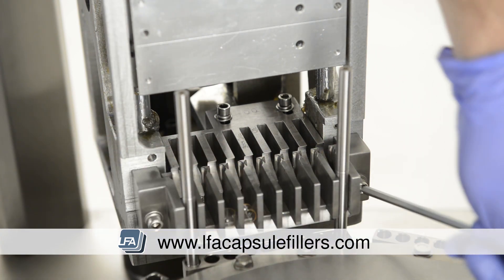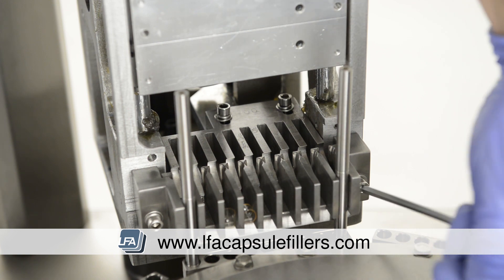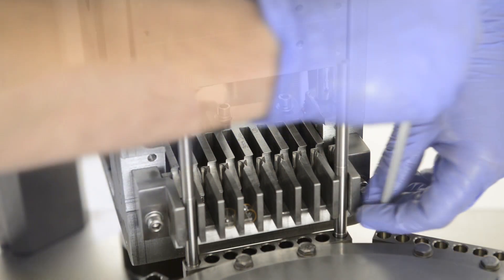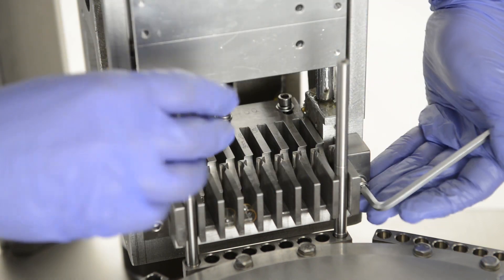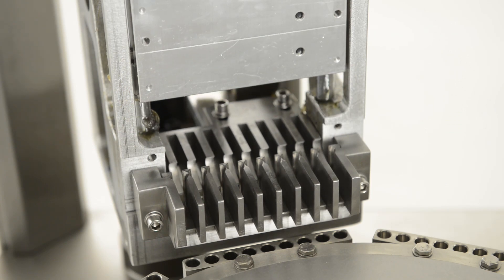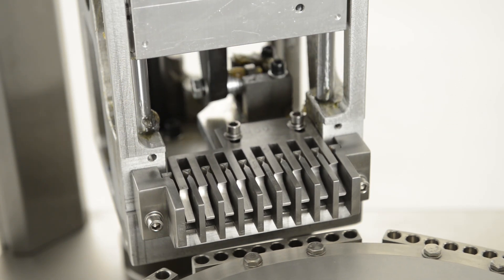We can now fully tighten the front two bolts. Turn them in equal increments, checking as we do this. Next, manually move the turret so the back teeth move to the furthest point forward in their cycle, just before they start moving back again.